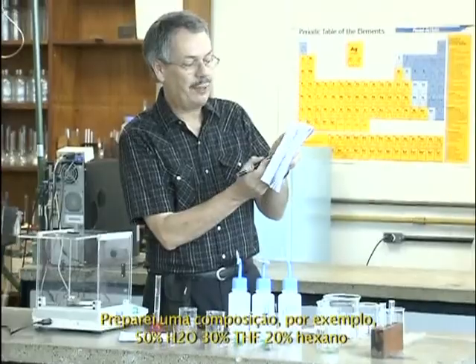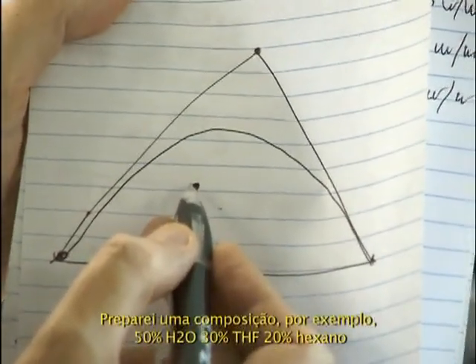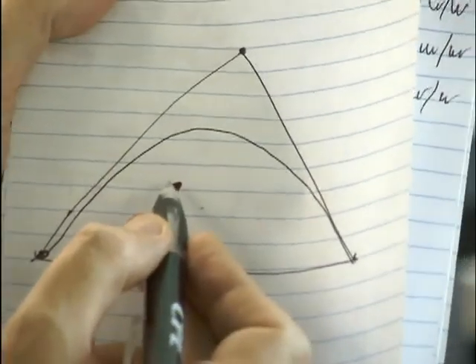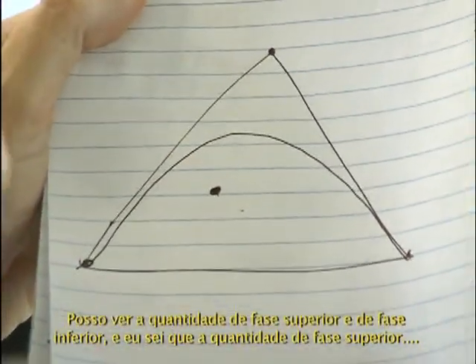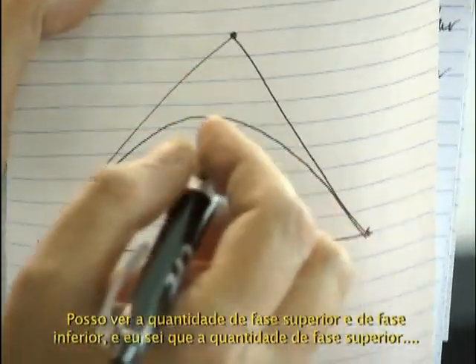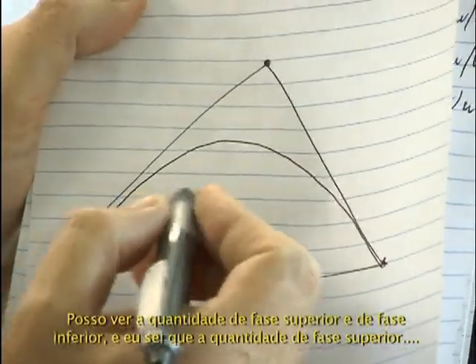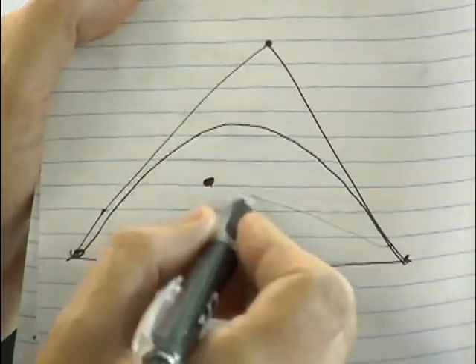Okay, I prepare a composition, say 50% water, 30% THF, 20% hexane. I can see the amount of upper phase and amount of lower phase. And I know the amount of upper phase times... suppose the tie line is like this. Suppose.